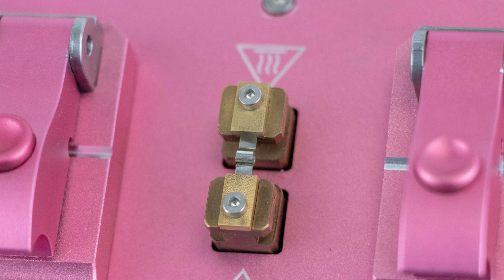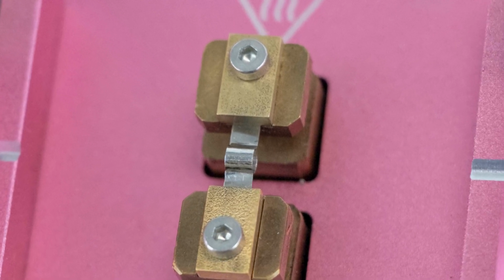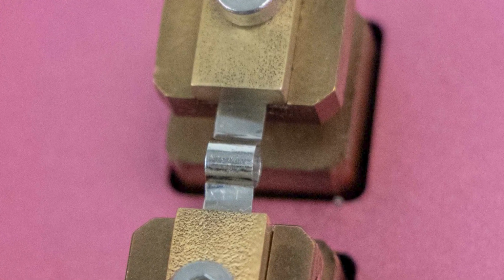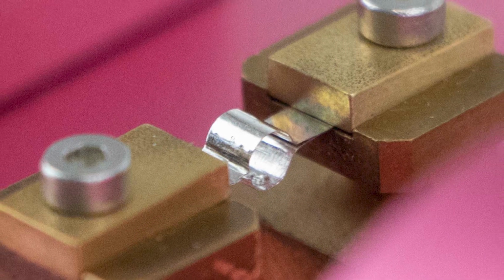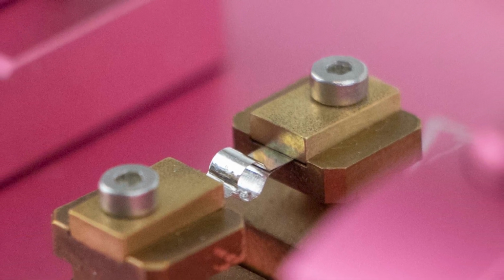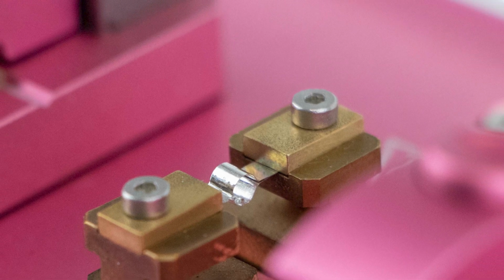Fourth, the filament is made of a platinum-iridium alloy, which is one of the most inert substances in the heating material market. Yet it still slowly oxidizes in the air's oxygen. And this causes a reduction of mass each time it's used. It will eventually burn out, but as the mass changes over time, the temperature that it produces also changes.